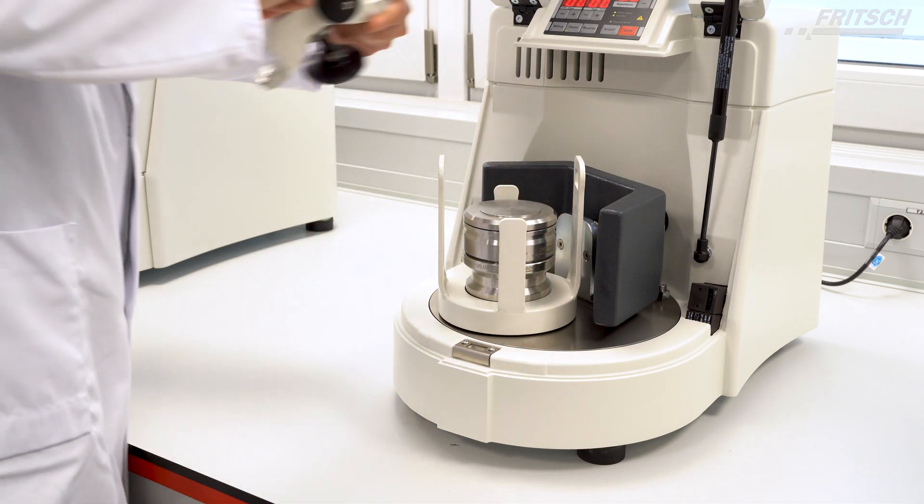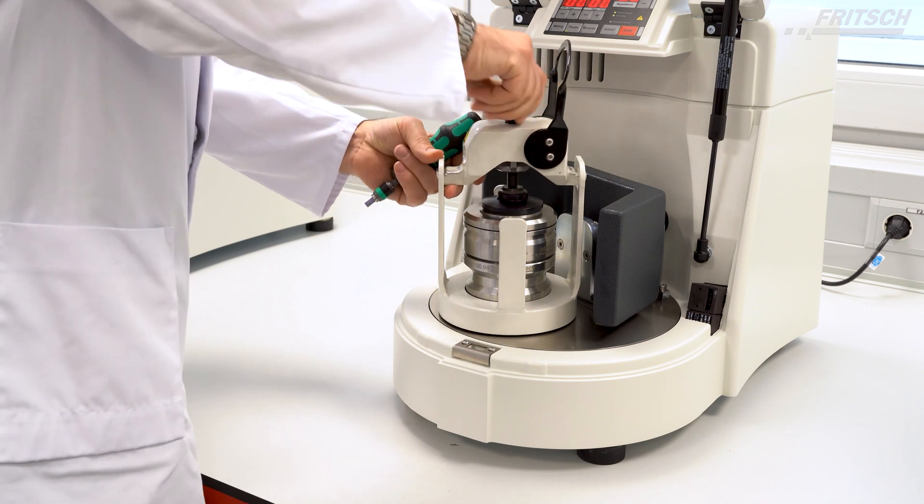The only exception is the 80 ml grinding bowl where you can put two on top of each other.